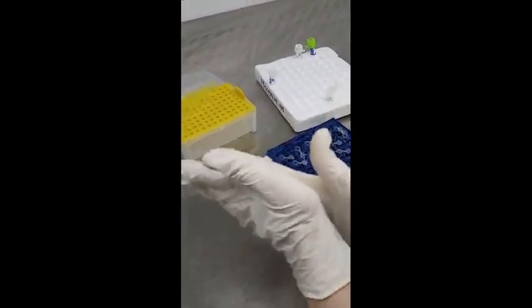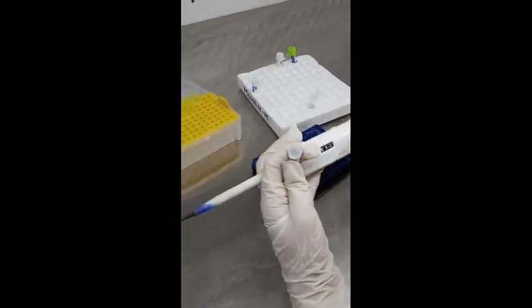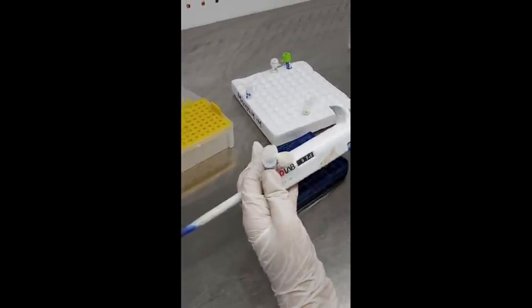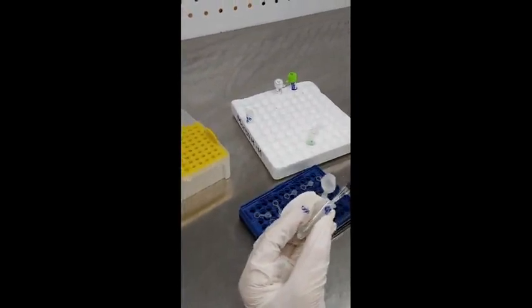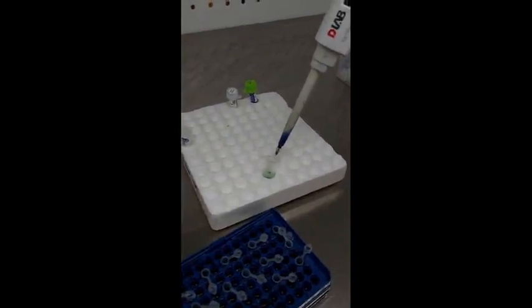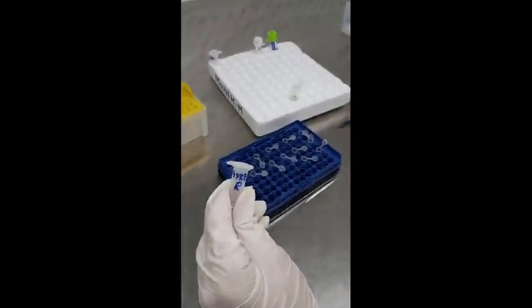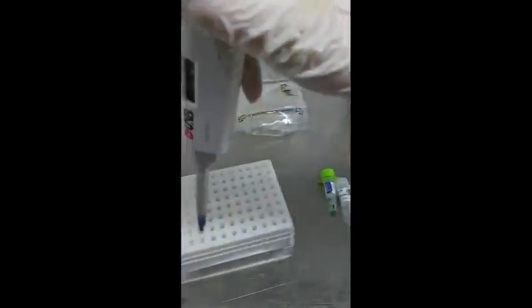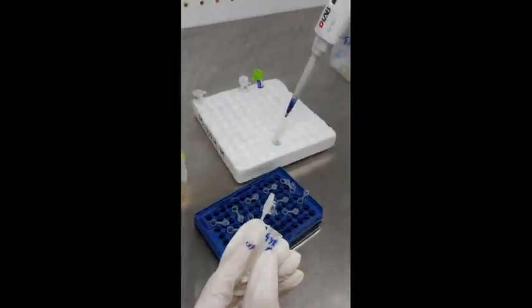These are the primers — we have already prepared them, so you have to thaw them. You have to add one microliter each of the forward and the reverse primer. Add one microliter of the reverse primer and one microliter of the forward primer to the tube that already contains the master mix and the nuclease-free water.